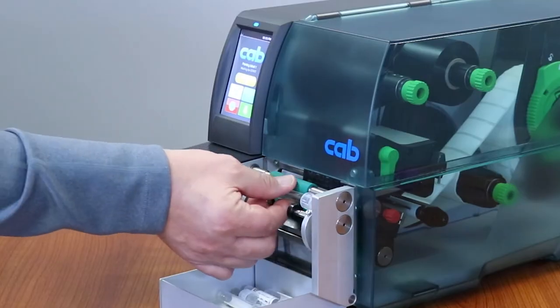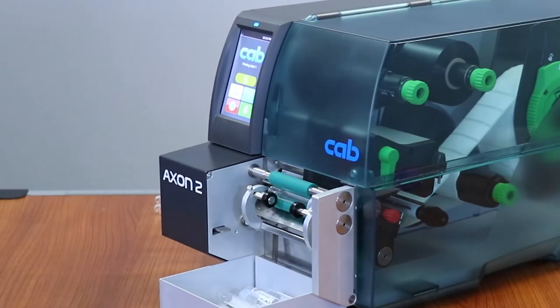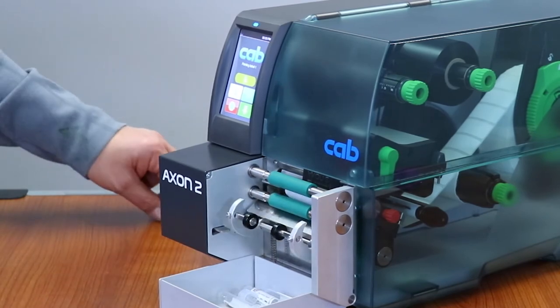Now here it is. I put my label on there, it's simple as this. Wasn't that easy?